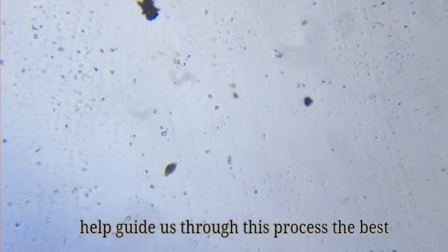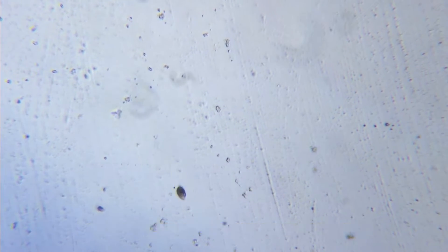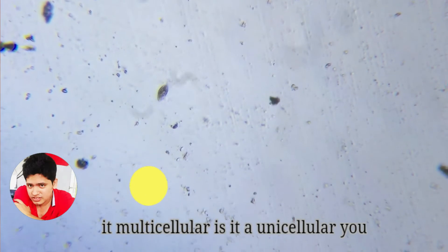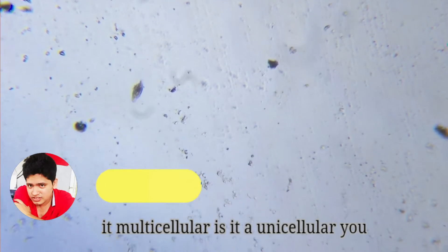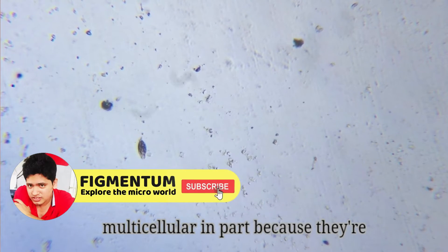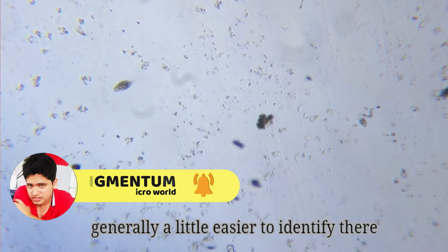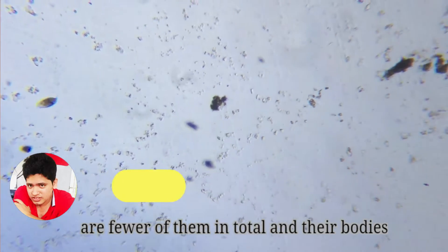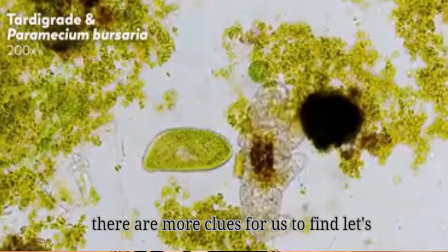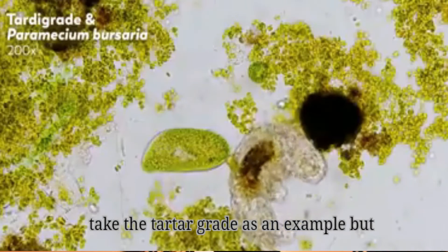So come along with us — let's take you through some of the questions that help guide us through this process. The best place to start is to ask yourself, in the broadest sense, what you are looking at. Is it multicellular? Is it unicellular? Is it a prokaryote? We'll start with the multicellular, in part because they're generally a little easier to identify. There are fewer of them in total, and their bodies just have more going on, which means there are more clues for us to find. Let's take the tardigrade as an example.